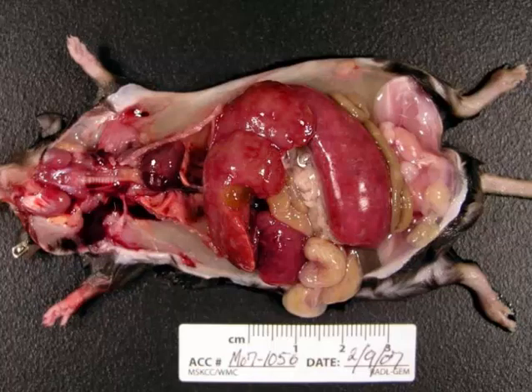In mice, histiocytic sarcomas arise from cells of the mononuclear phagocytic system and commonly affect the liver, in females the uterus, and less commonly the spleen, lymph nodes, lung, kidney, and bone marrow. If you select 100 mice with big kidney and big spleen, I'll put it at about 5%, no more.